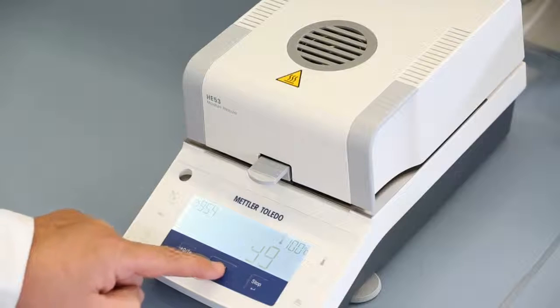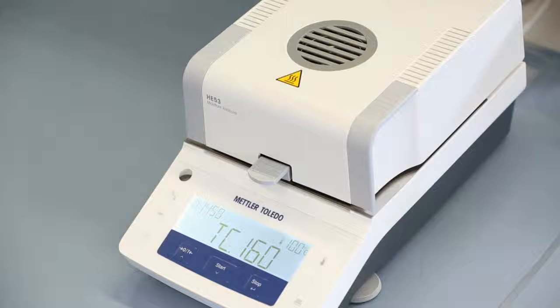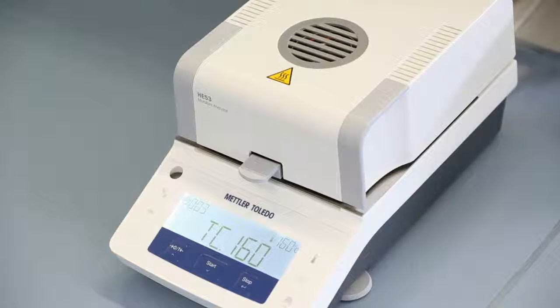The instrument will heat up now to 160 degrees for another 15 minutes and then it requests the value at the second adjustment point.